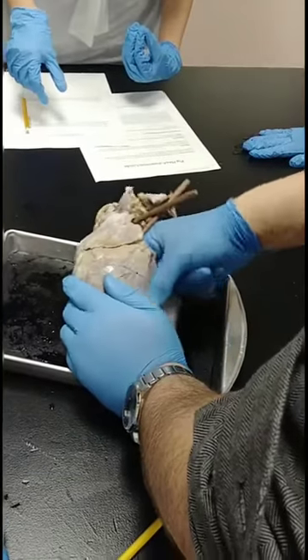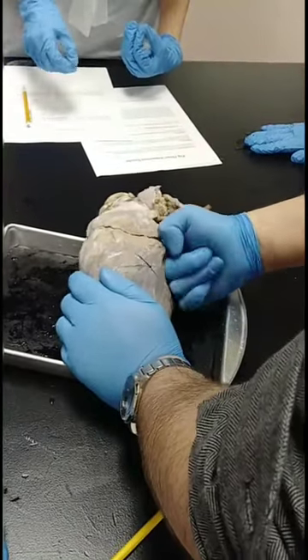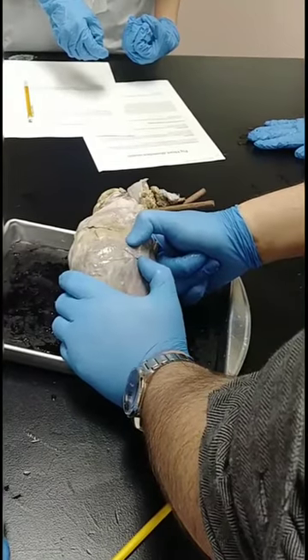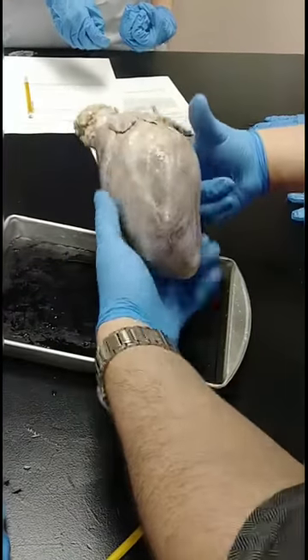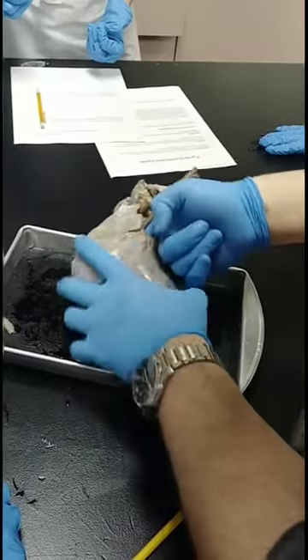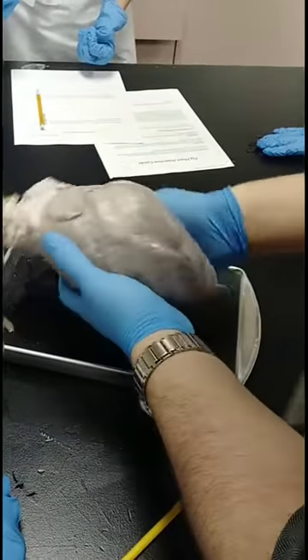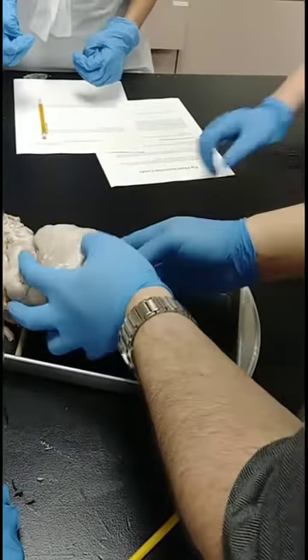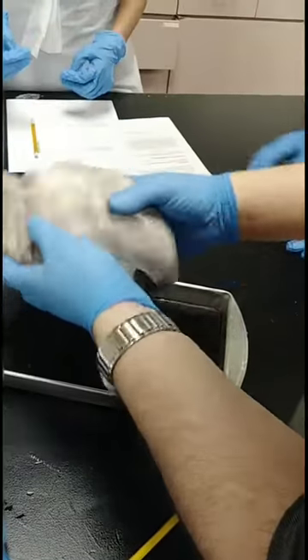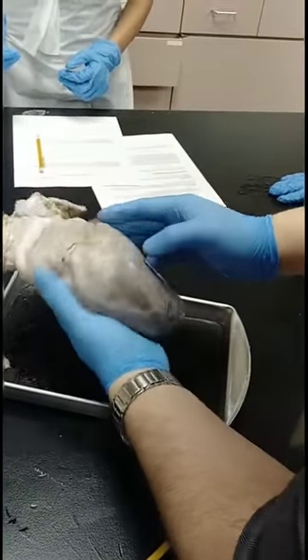You can see just where it goes. Now, if it's oxygen-poor blood, what's that going to go to? The right side. Remember, the chambers wrap around. So the left ventricle wraps around like this, and the right ventricle wraps around like this.